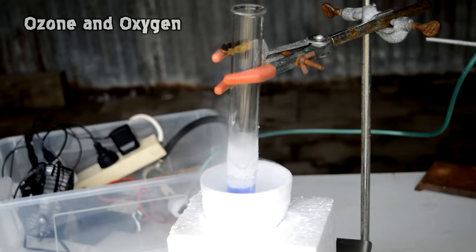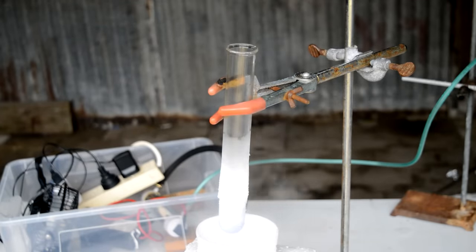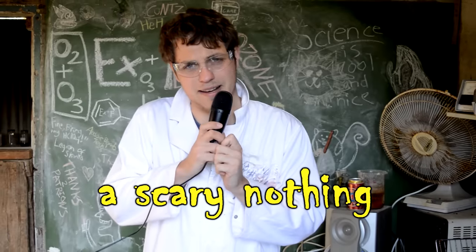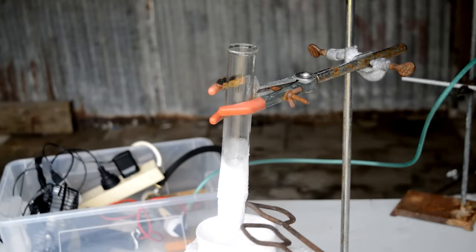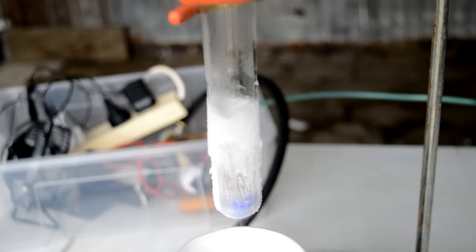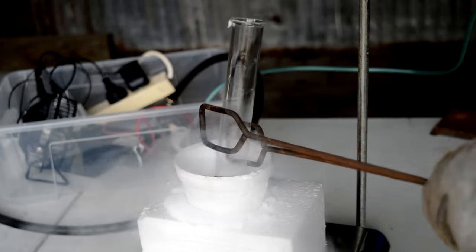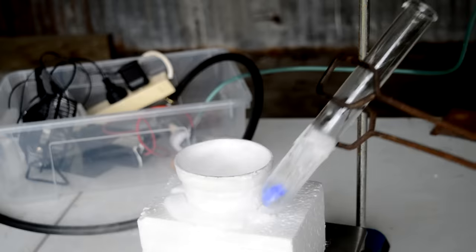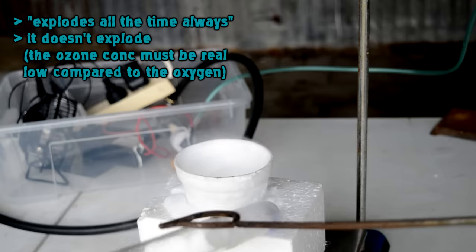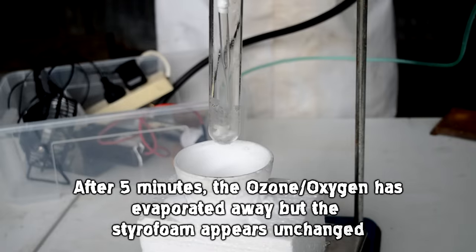However, let's do one more experiment. What if we got that same oxygen and ozone mixture and then we added a carbon source to it — something to be oxidized, such as styrofoam? There's initially a very tiny reaction and then nothing — a sort of scary nothing. Rather than the ozone just boiling away, the ozone soaked into the styrofoam. The styrofoam just turned purple and all the ozone went into it and stayed there for about five minutes. To say this is an explosion hazard is a bit of an understatement — it's a very intimate mix of a fuel and an aggressive oxidizer, but it didn't blow up. Even when we poked the bear it didn't do anything, it just sort of heated up. But maybe that's a good thing and we should probably quit while ahead because there's a lot of glass shrapnel that could potentially be thrown around.